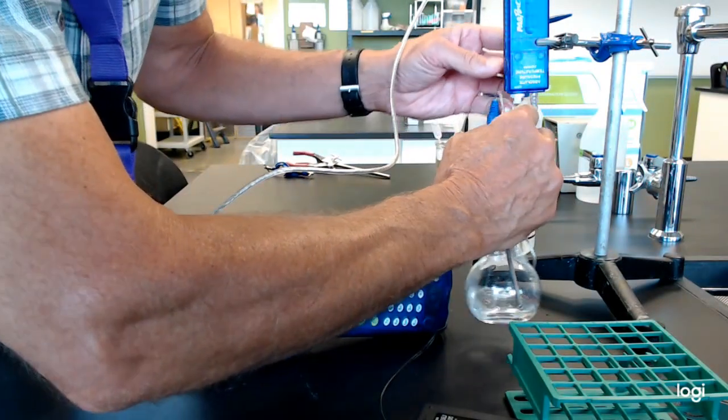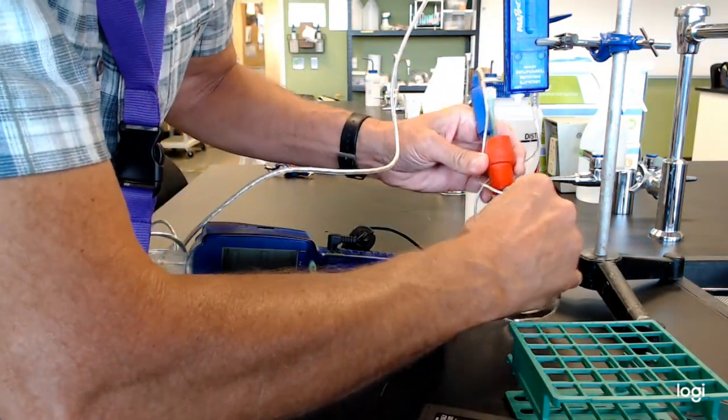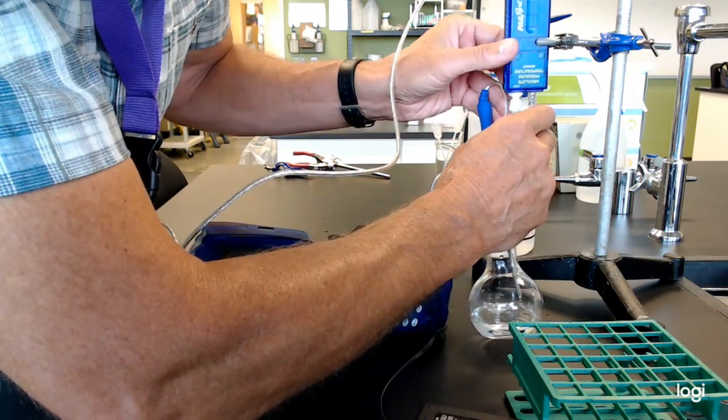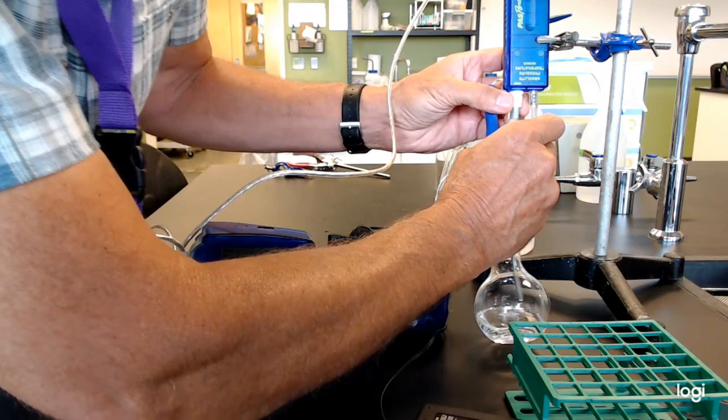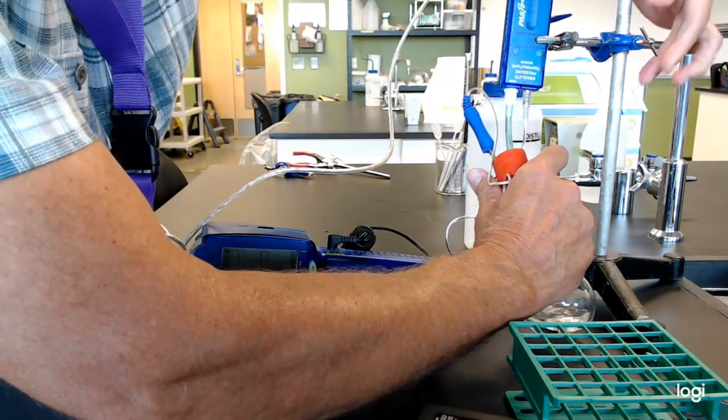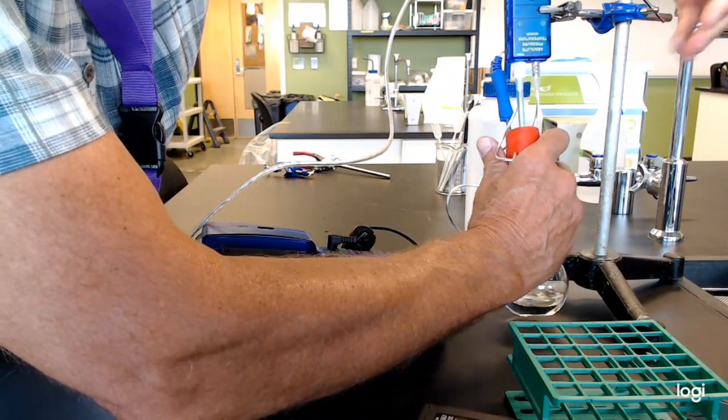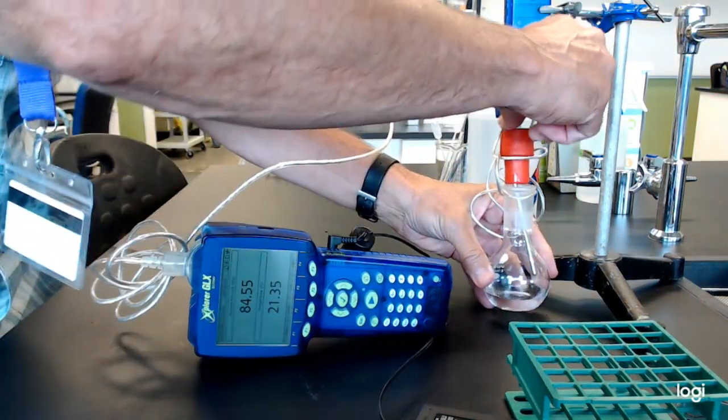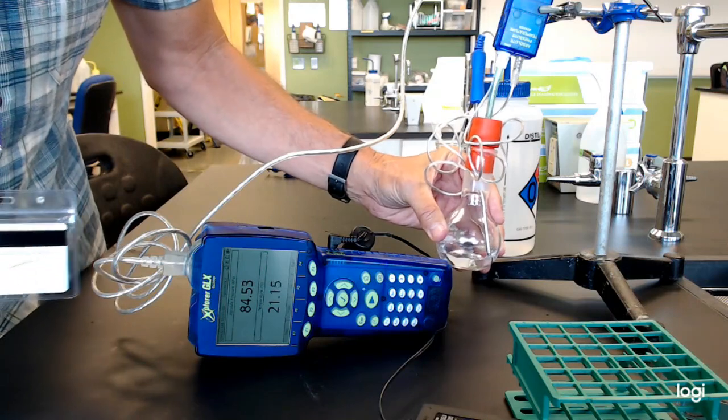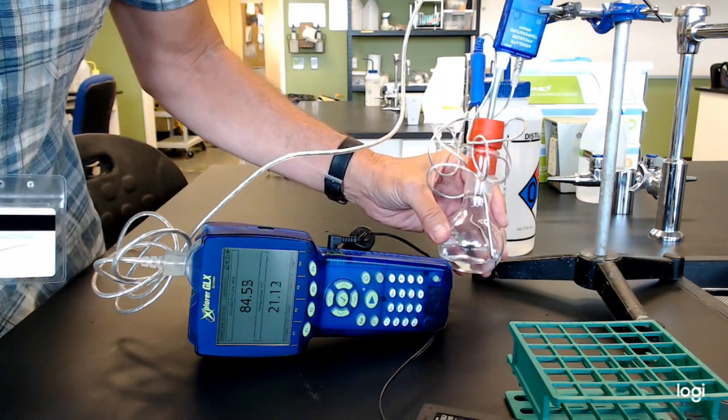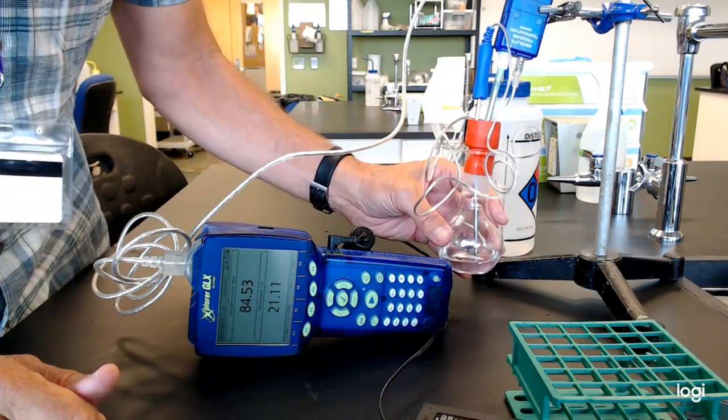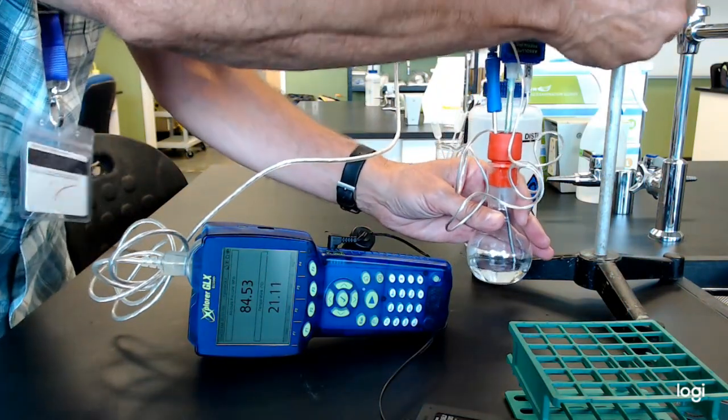Oh, time out. I'm not even reading pressure. Let's get this back into the box. And then that's going to be a valid test. All right, click in. Get a little space to work with. Let's try this again. Can you see the pressure now? Yes. All right. See a little jump. And if not, then you might need to check your septa, and you also might want to check this thermocouple lead that it's nice and tight. But anyway, that's what you might do to double check that.